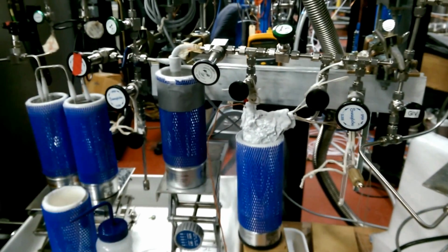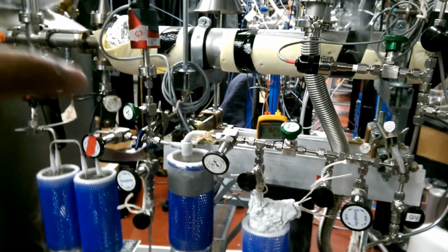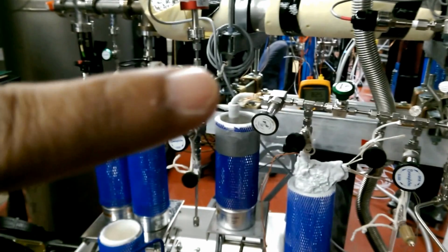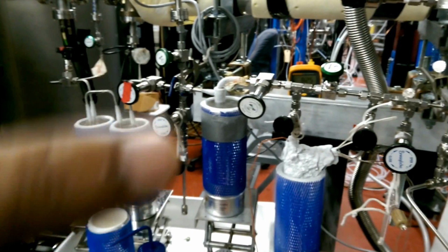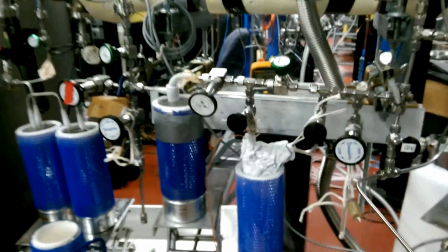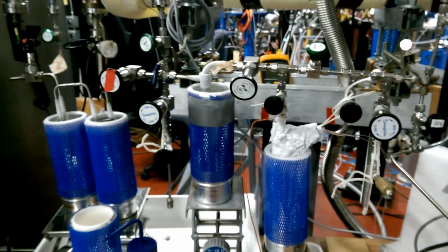Once the experiments are done, we'll collect the condensables in these three traps by elevating the temperature of this reaction chamber to close to room temperature. So everything will come and freeze back here, and finally we'll collect in the sample tube what is condensable, maybe CO2 and water. We'll take the CO2 and water to UCSD, separate them cryogenically, and do isotopic analysis of carbon and oxygen on these two species.